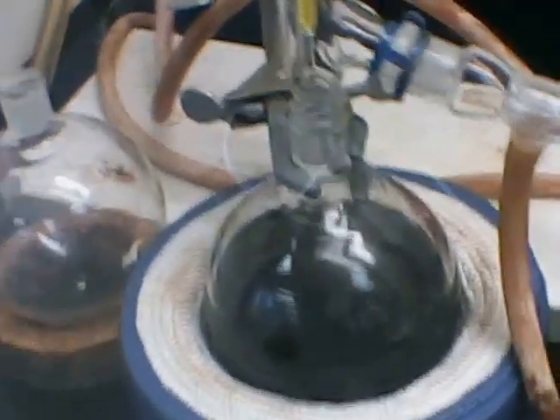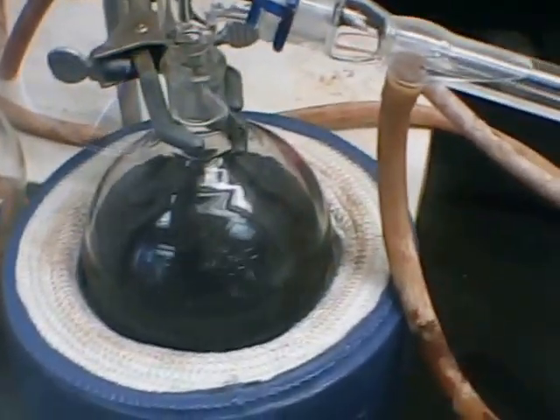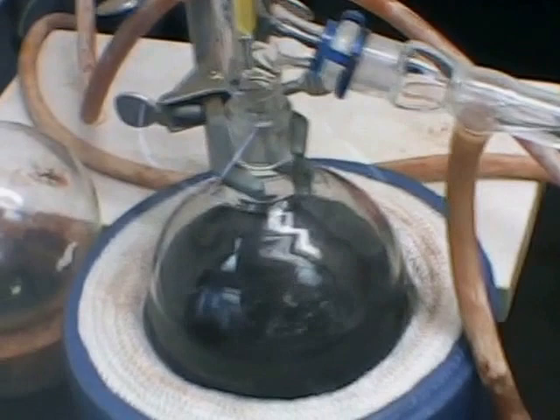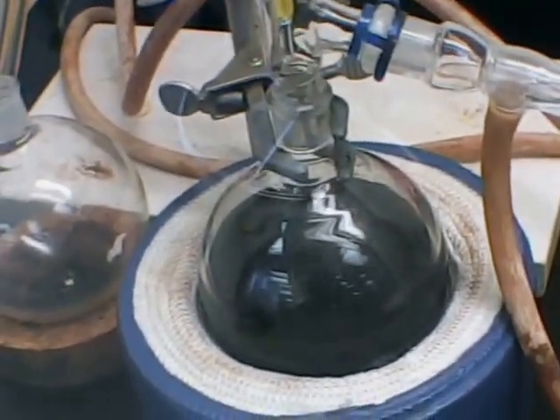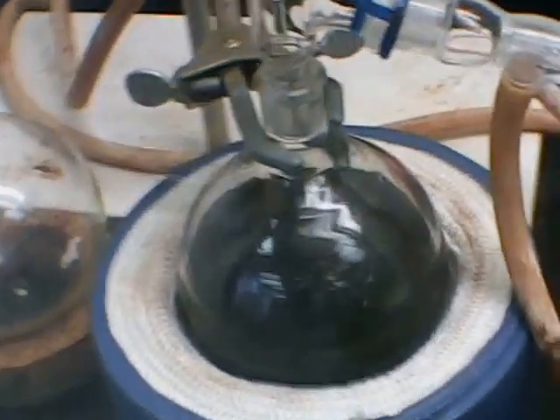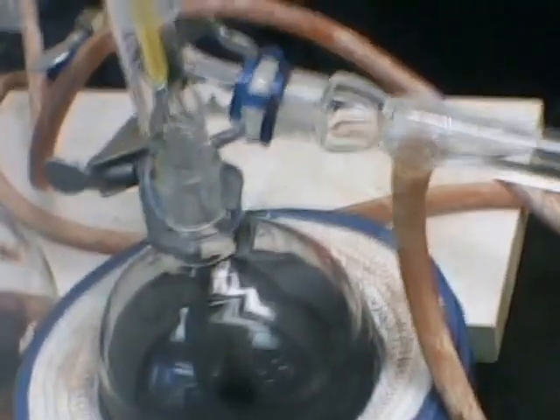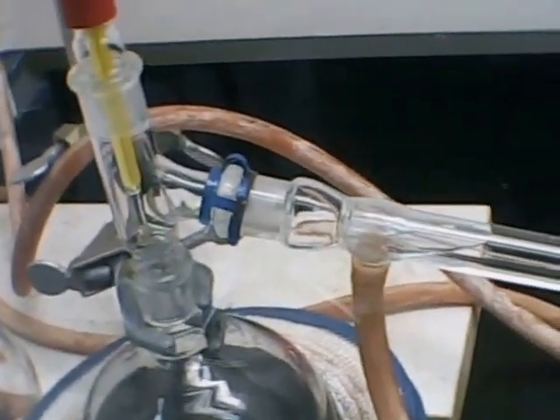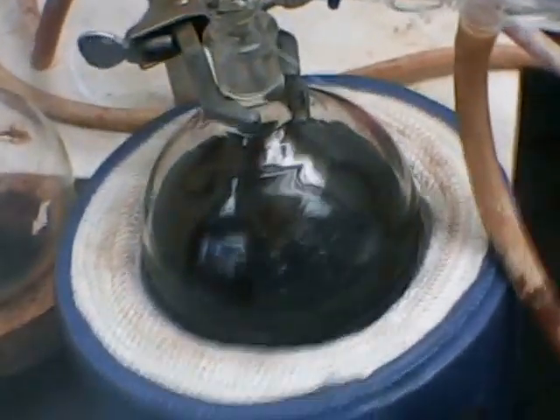A local company, MSL Oil and Gas, here in western Pennsylvania, was kind enough to donate five gallons of drip gas, so-called drip gas, which is natural gasoline from one of their natural gas well heads. And this natural gasoline with low octane number, I would imagine the research octane number would be 60-65.